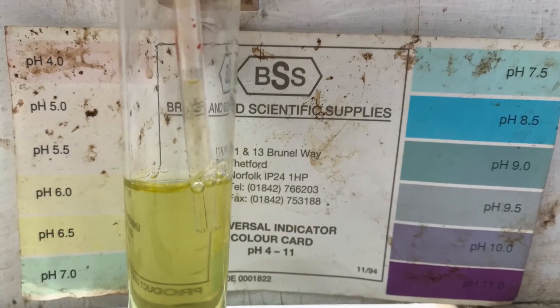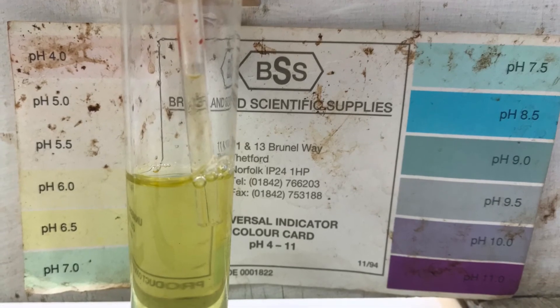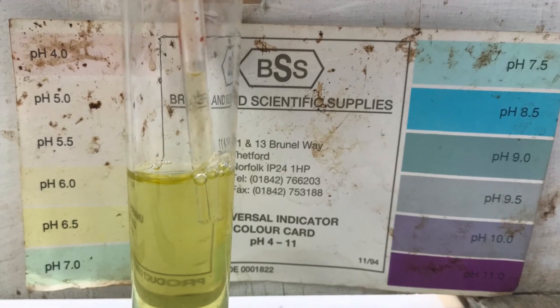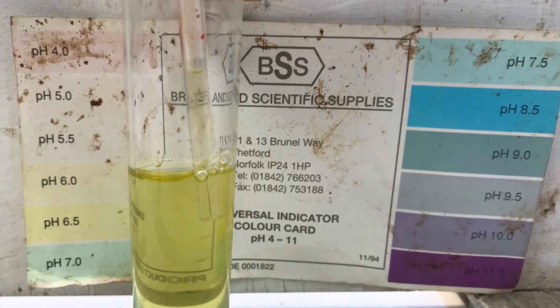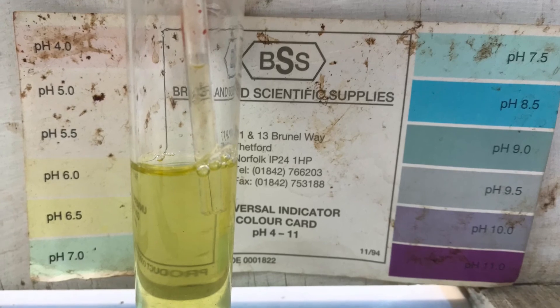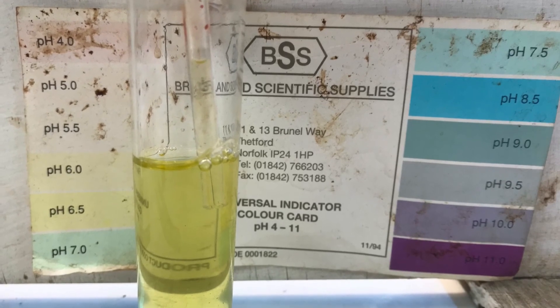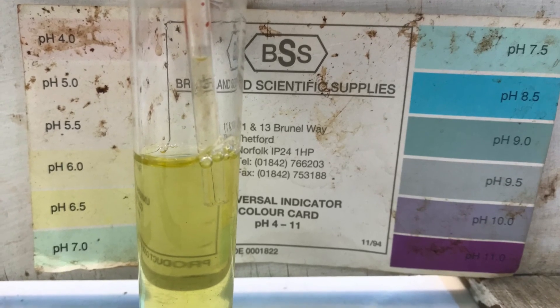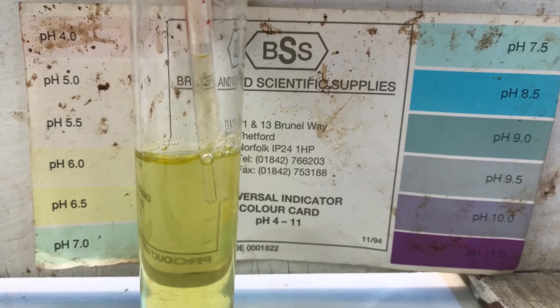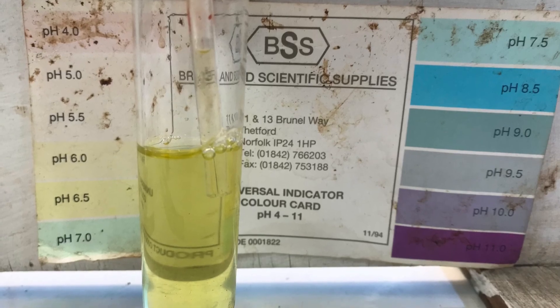As we can see on our universal indicator, the colour has gone from green to yellow, which indicates acid rather than alkaline. That means acidic particles in the air, which cause cancer.